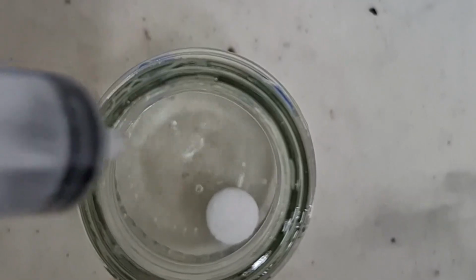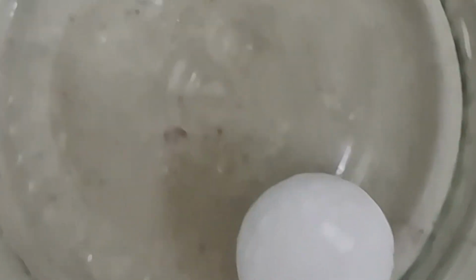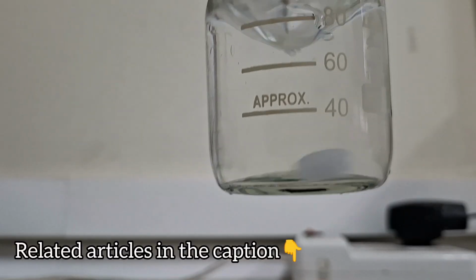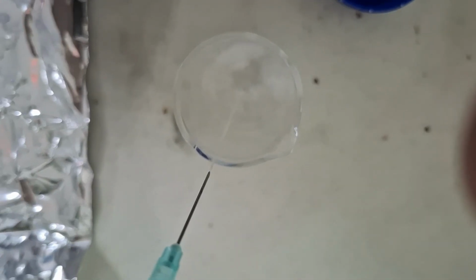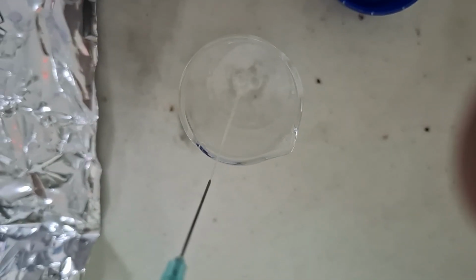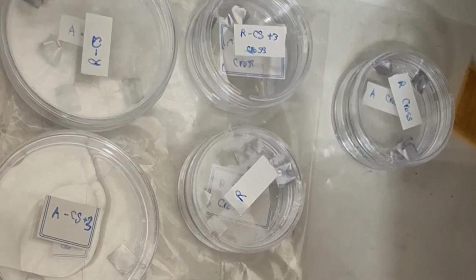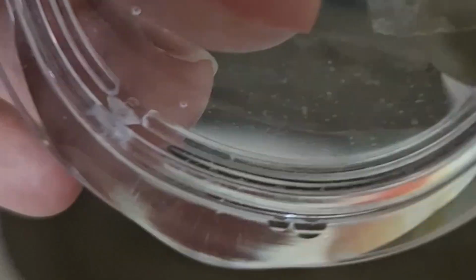At defined intervals, for example every 3 days or every 7 days, you should replace the PBS in the containers. Collect degradation data at specific time points, which for typical polymer tests are often day 1, 3, 5, 7, 14, 21, and 28. The scaffolds are weighed. You can also measure pH changes at the same time as the weight measurements.